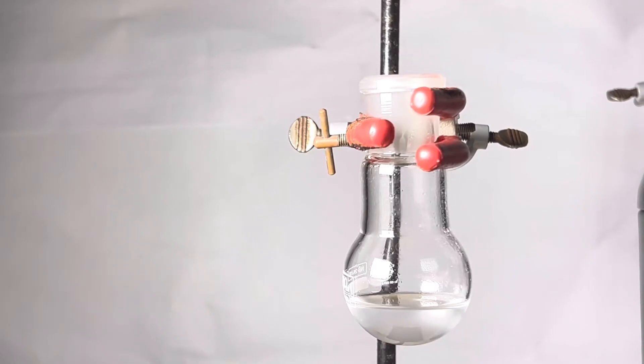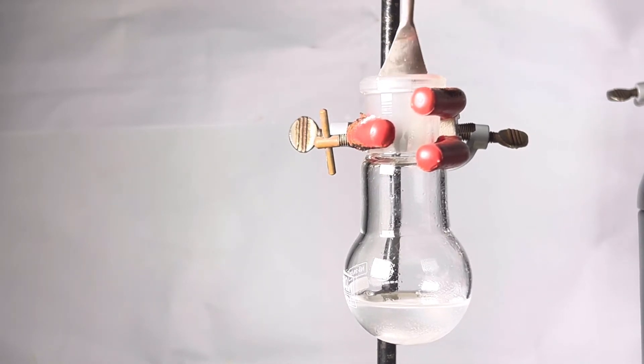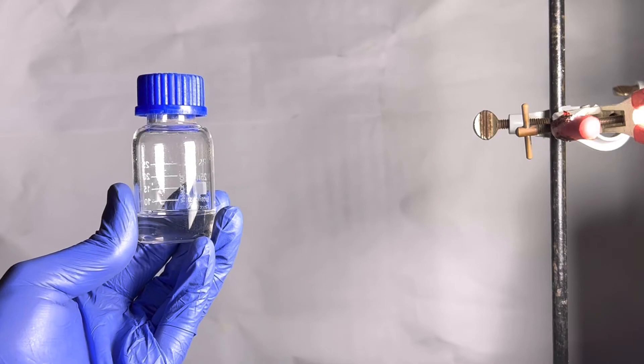The compound was made water free by dumping some anhydrous sodium sulfate. The final yield that we collected was 7.9 grams.